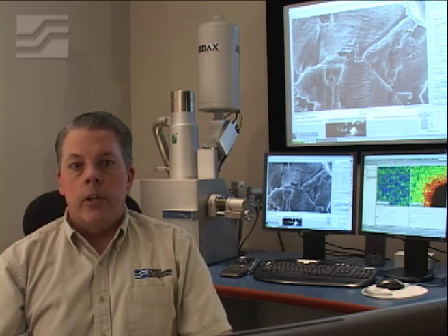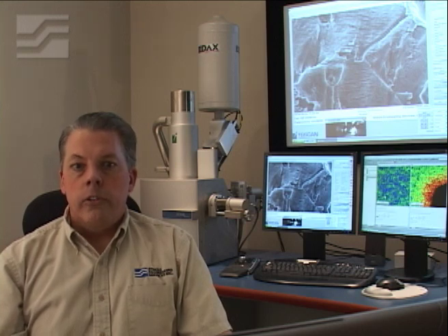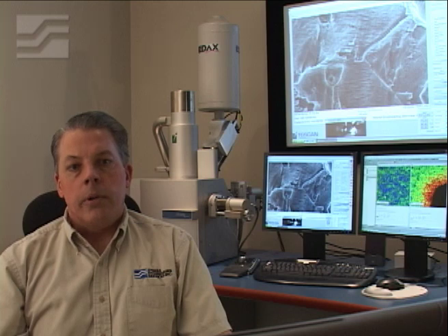The SEM also provides much greater depth of field than light microscopes, allowing complex, three-dimensional objects to remain sharp and in focus. This gives them a life-like appearance and reveals details that would not be seen by light microscopy.